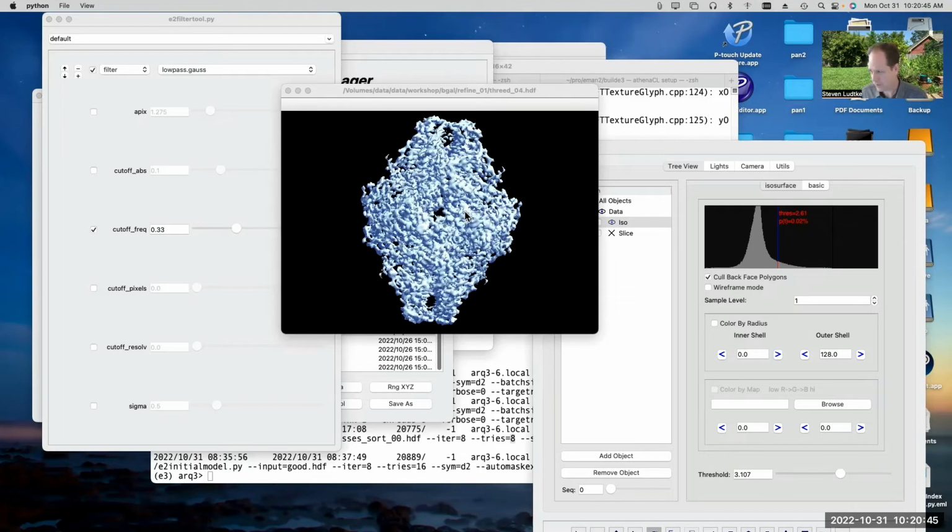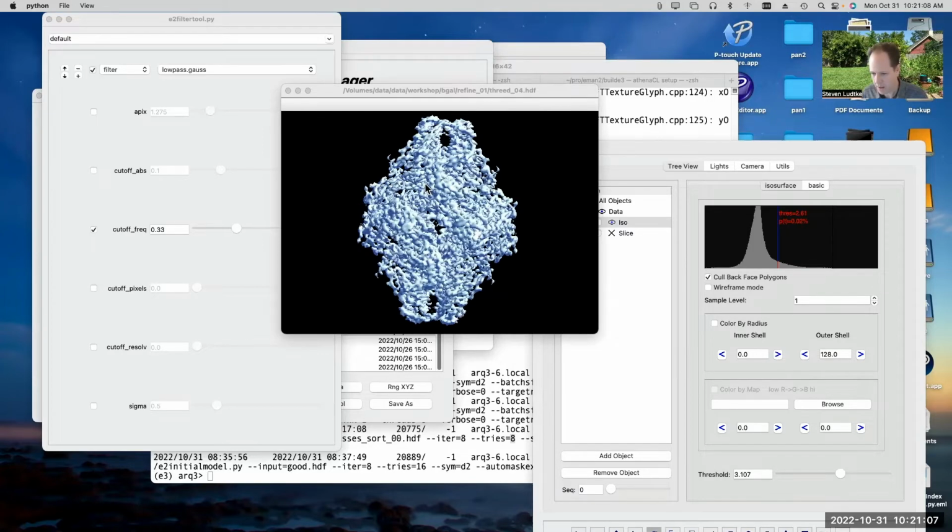So the filters are sequential in that way. Now, if you do a top hat filter, where you go out to some resolution and just do a sharp cutoff to 0, then that isn't true. If you filter to 4 angstroms and filter to 4 angstroms again, the top hat filter will be exactly the same after both of them, because it's basically just throwing everything away at high resolution. It's not doing anything at low resolution at all.